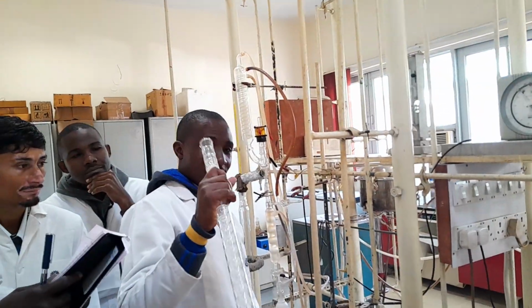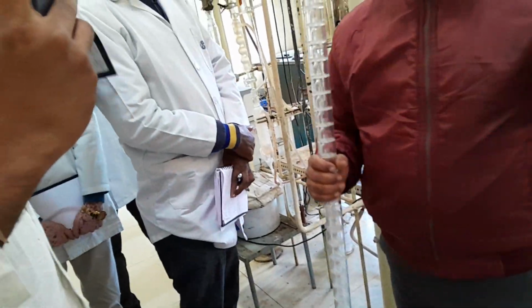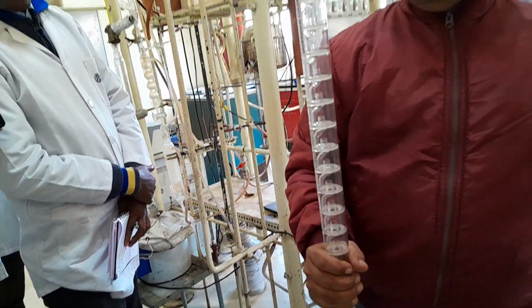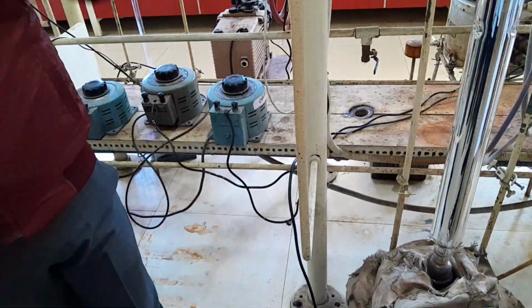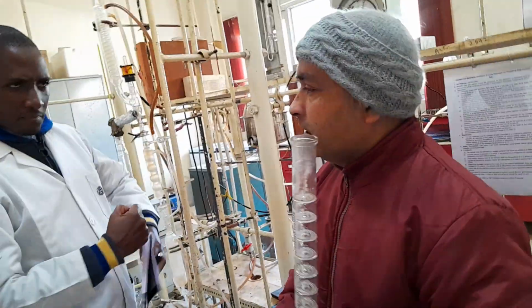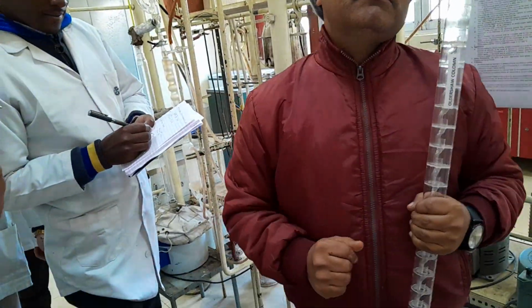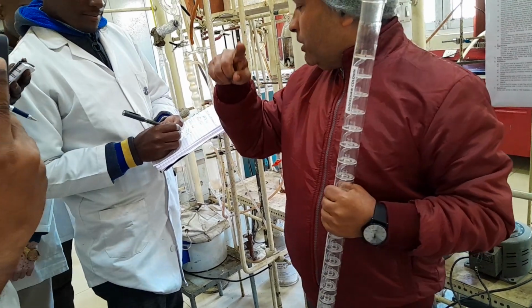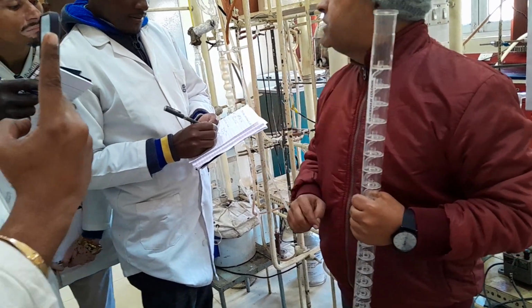Do you think it is maintaining the pressure inside? Between these two walls, this is the inner one and this is the outer wall, and then evacuation. It is sealed and it has been evacuated. This column is holding a pressure of 10 to the power minus 6 mmHg. Now think of 10 to the power minus 6 mmHg.